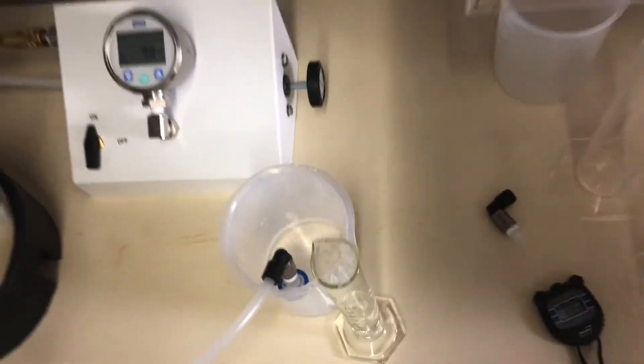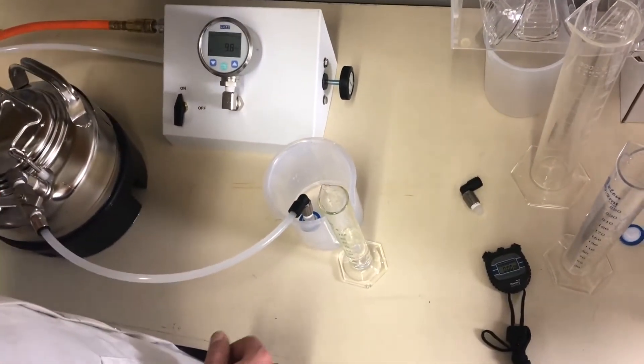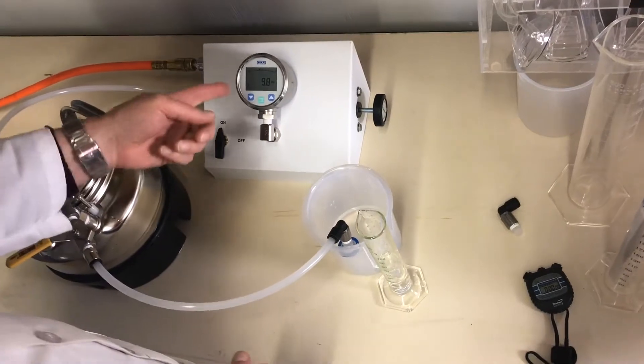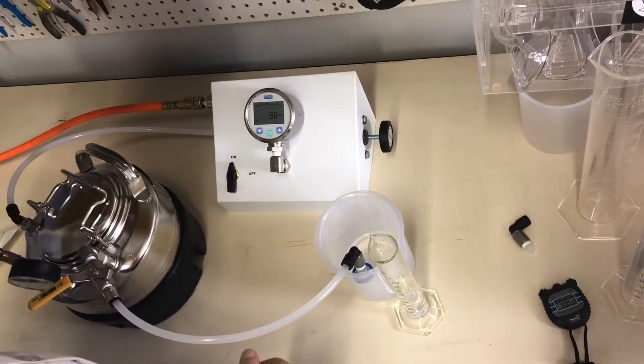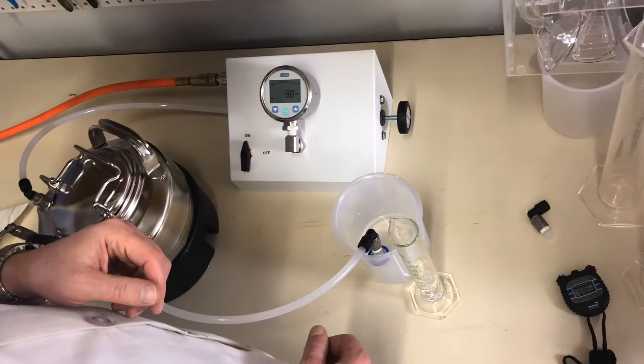Then we'll stop the flow. We finished the test. I forgot to check the pressure, but we're still good at 9.8. I checked, don't worry.